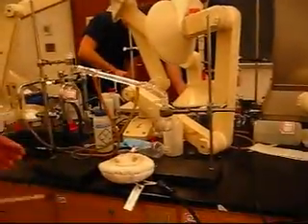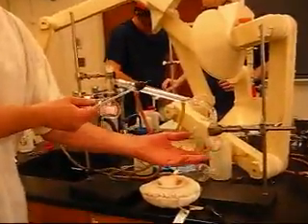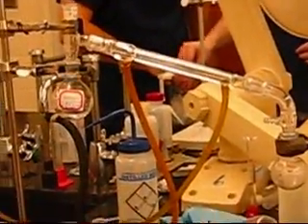What we did was we took our distillate flask right here and put it in as our crude flask right here — we traded places. So what we're going to do is do the distillation again to make sure we catch it at the right temperature.